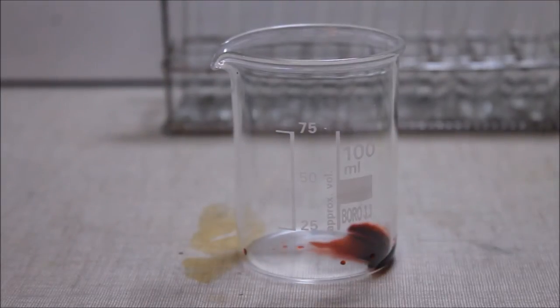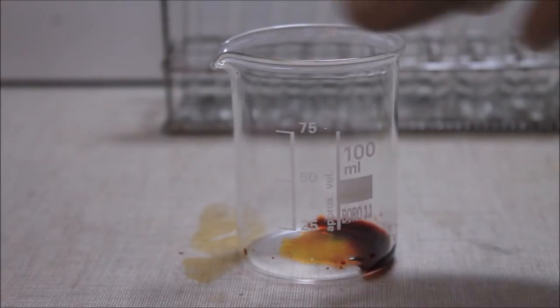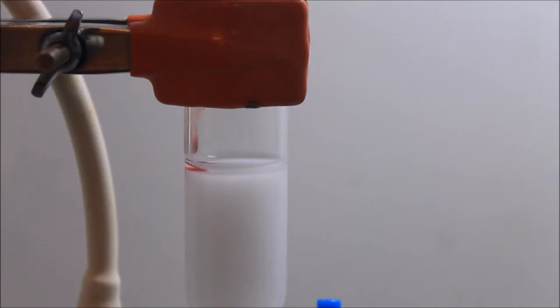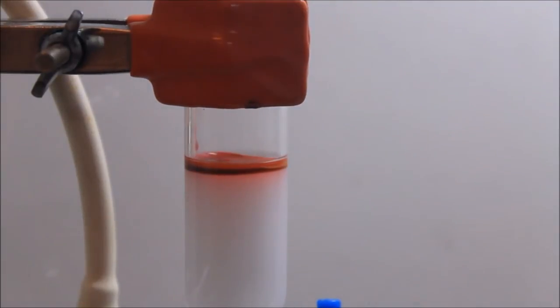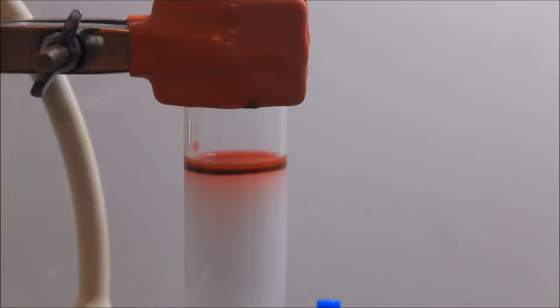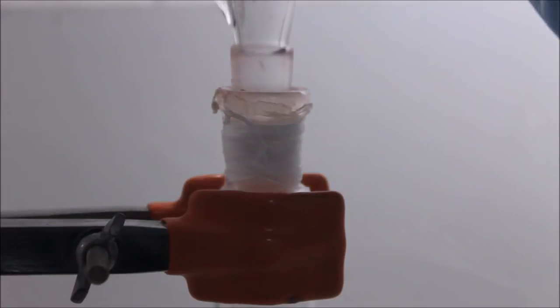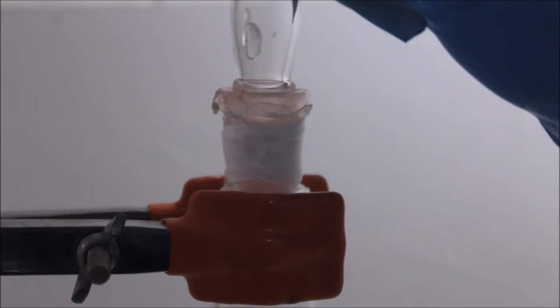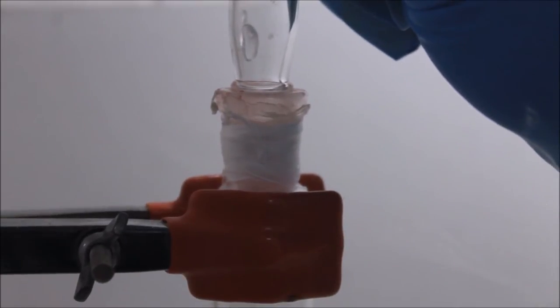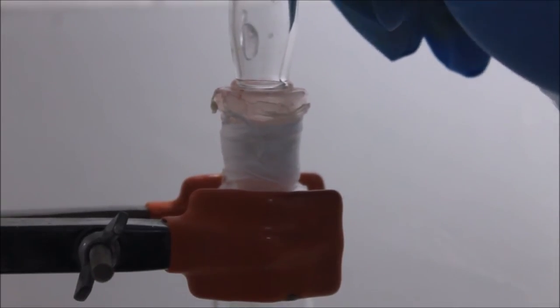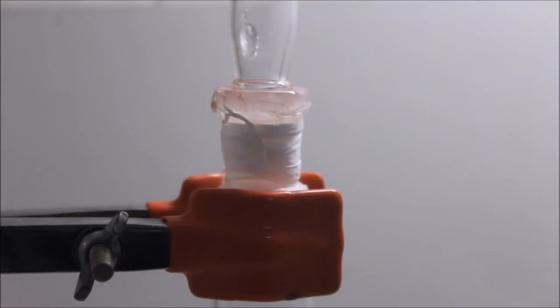In the meantime, the sample is prepared by mixing equal volumes of the two organic dyes. Using a pipette, the sample is uniformly added to the column. Now the sample is let to enter into the column. This should be done as fast as possible in order to avoid band broadening. This step can be forced by applying some air pressure through the column.